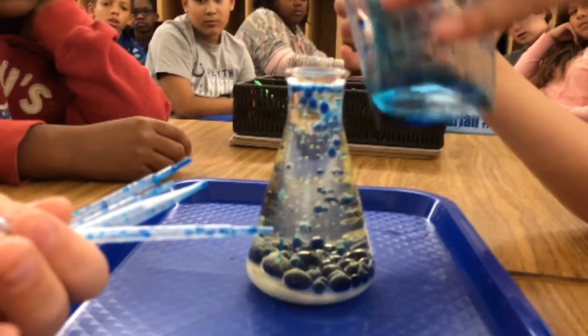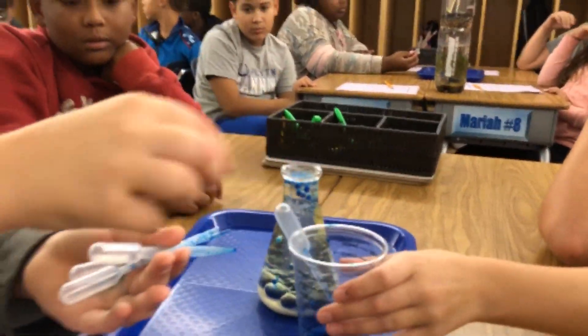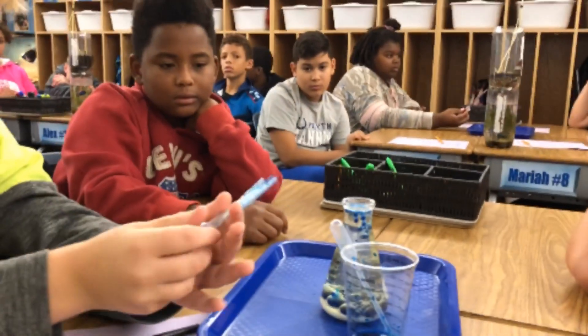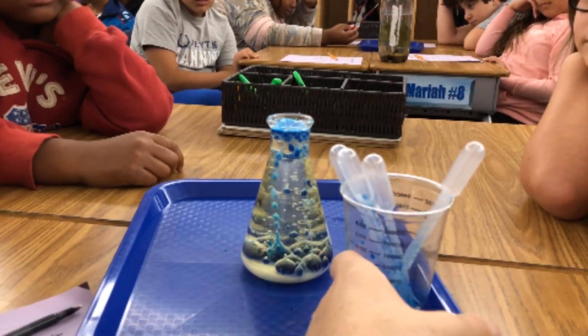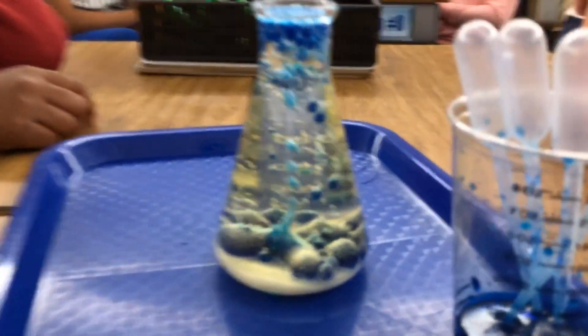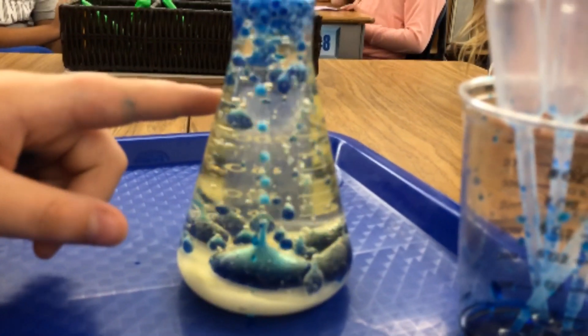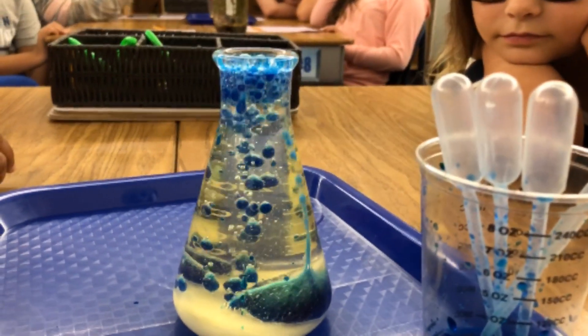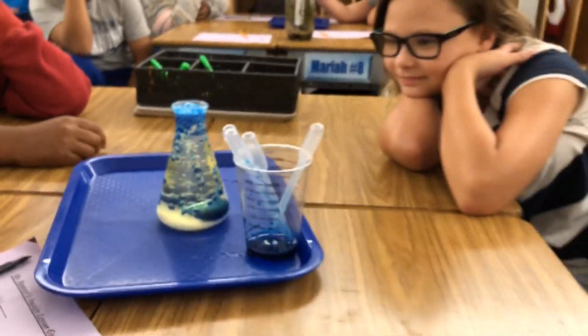So what's happening here — this is decomposition, but it's endothermic. It actually has a cooling effect. Your sodium bicarbonate is breaking down into carbonic acid, then it decomposes into carbon dioxide that you see, and sodium acetate which is left on the bottom. Isn't that cool — this is the blue lava lamp. Well done, table two.